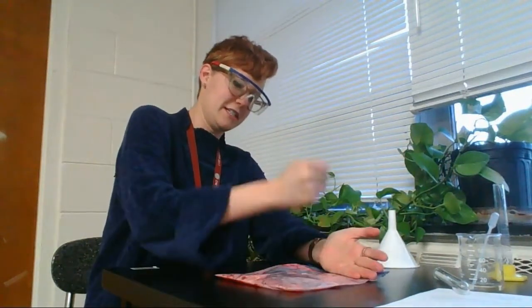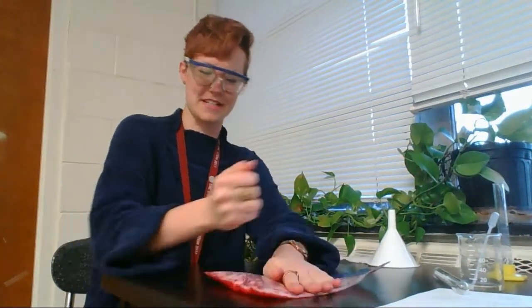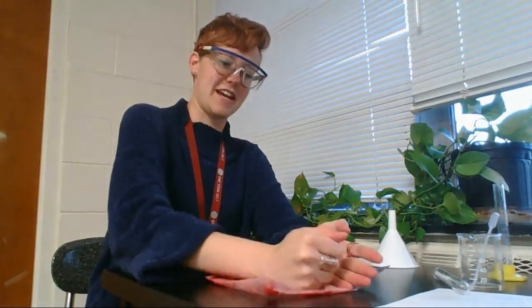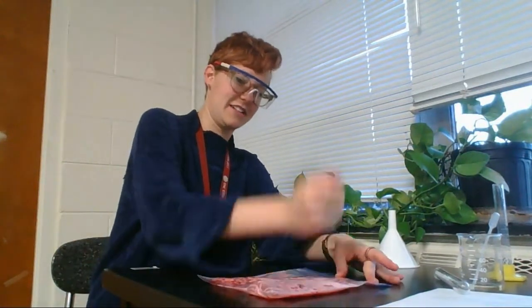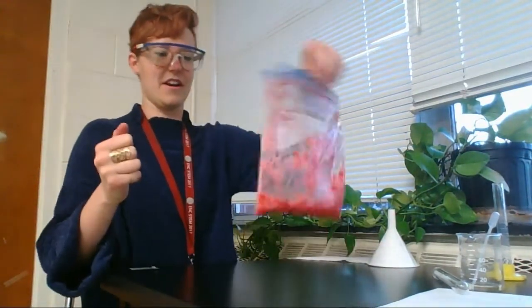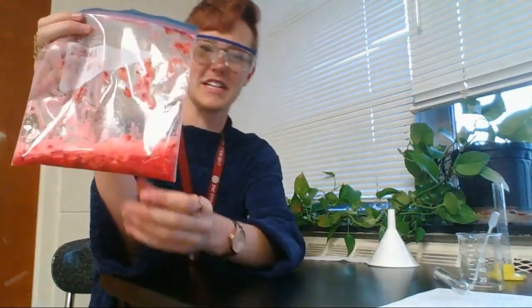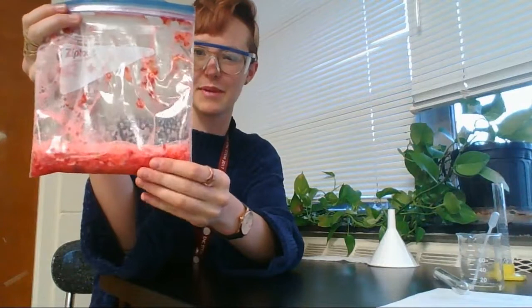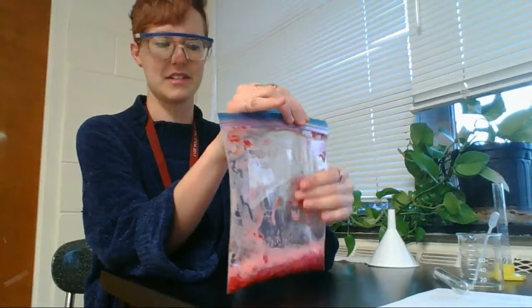I'm picturing things that make me mad right now. I'm picturing a couple of y'all's faces. Just kidding. Smash up your strawberries as best as you can. It's going to make some like weird, almost looks like a really disgusting strawberry smoothie mixture. You should do this a little bit longer than I did in the video, for like a couple minutes.